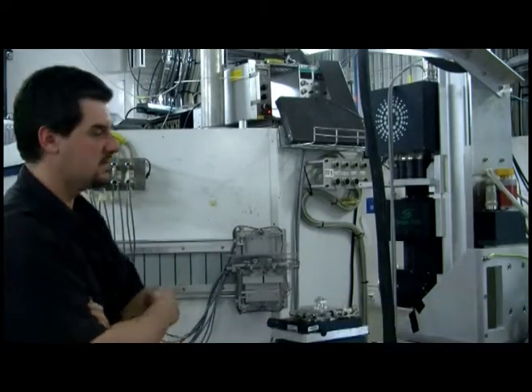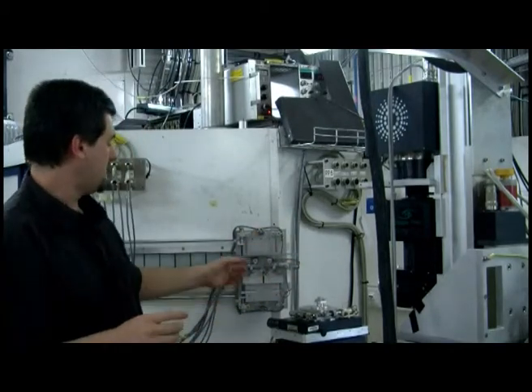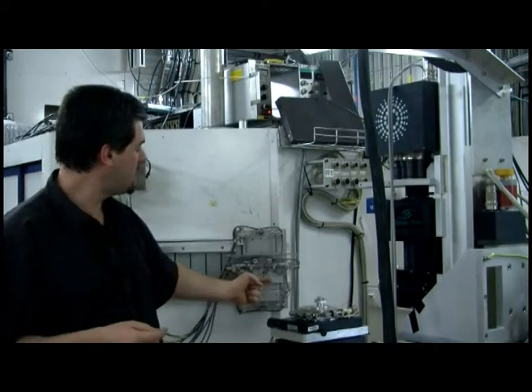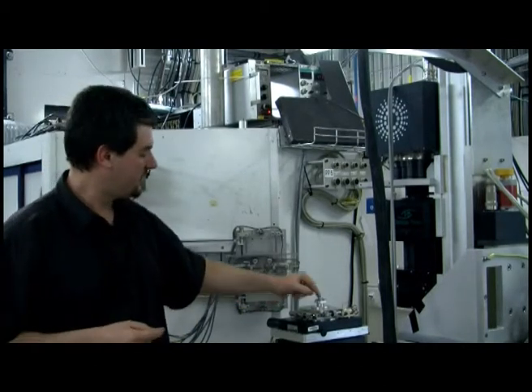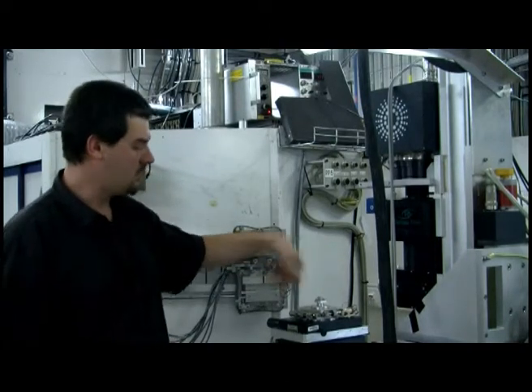Okay, so here you are on the beamline ID 19, and that beamline is mostly used for microtomography. It's an X-ray imaging technique. And so the device you are seeing here is a microtomograph. To explain in a very simple way how it works, you have the X-ray beam coming from here. The sample is put on that sample stage, and it can rotate and move.